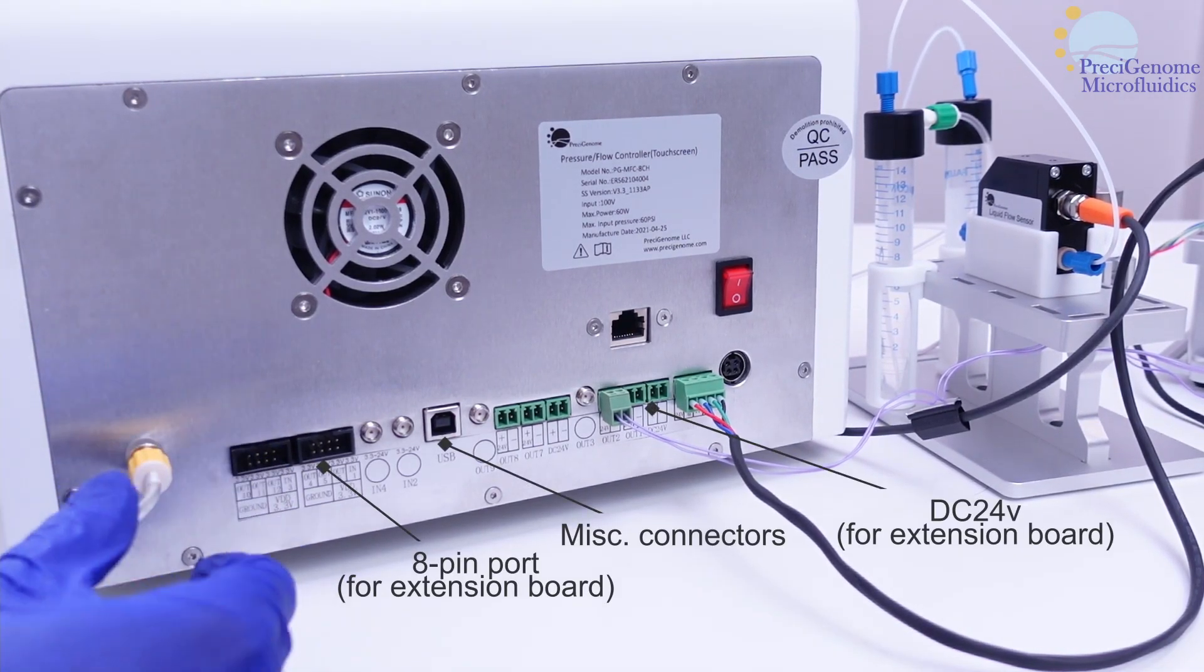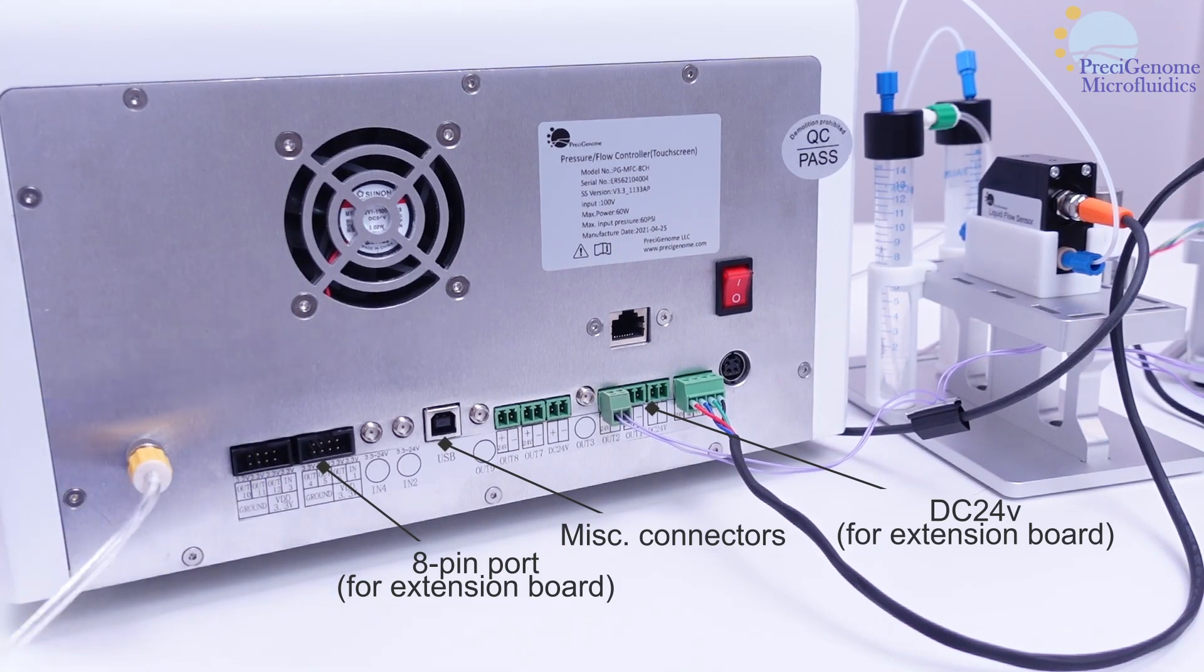There are other ports on the I.O. which are less commonly used, but some listed here may be used to power extension boards for more valves.